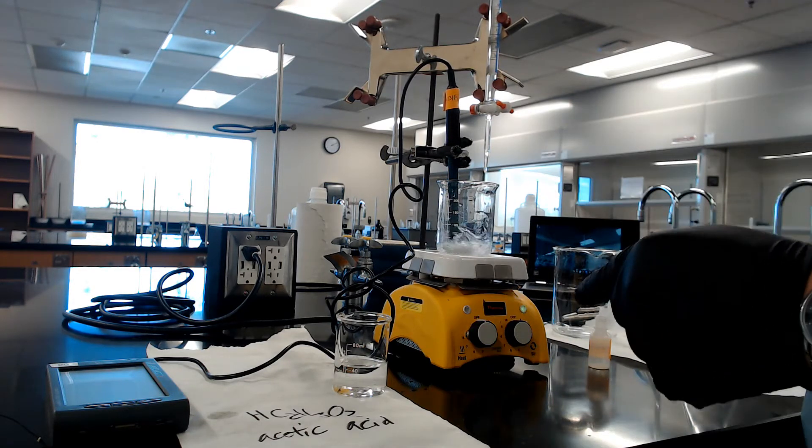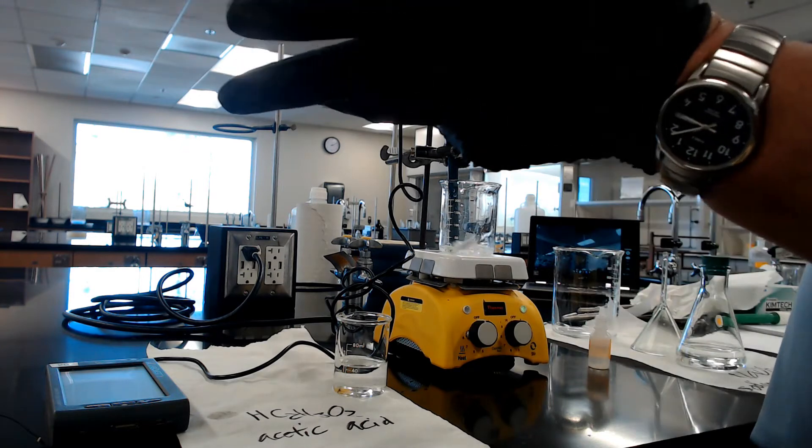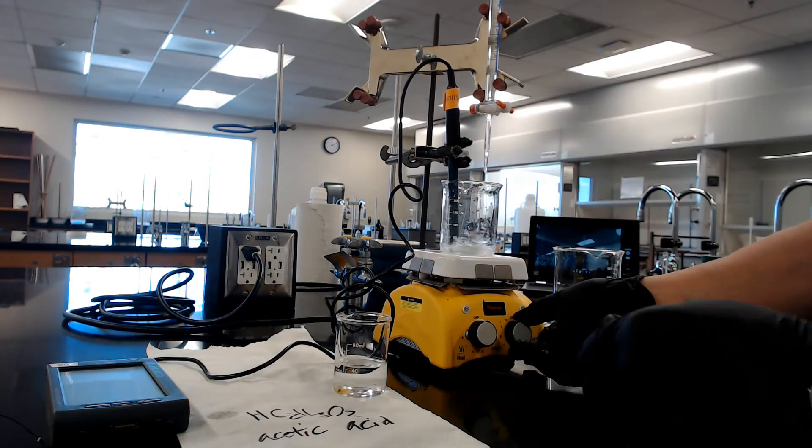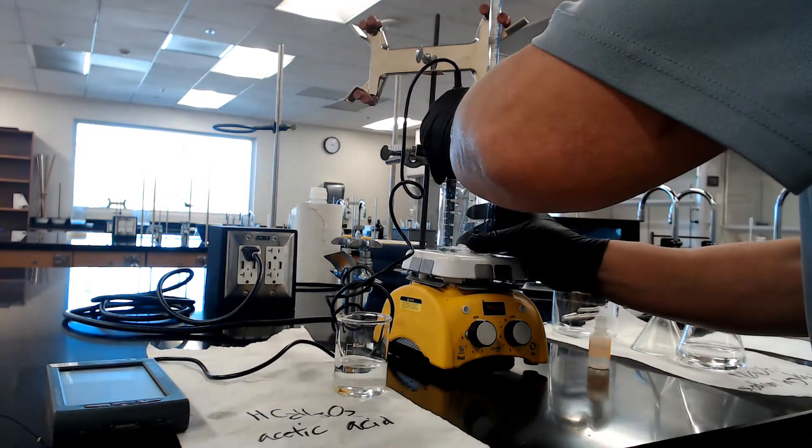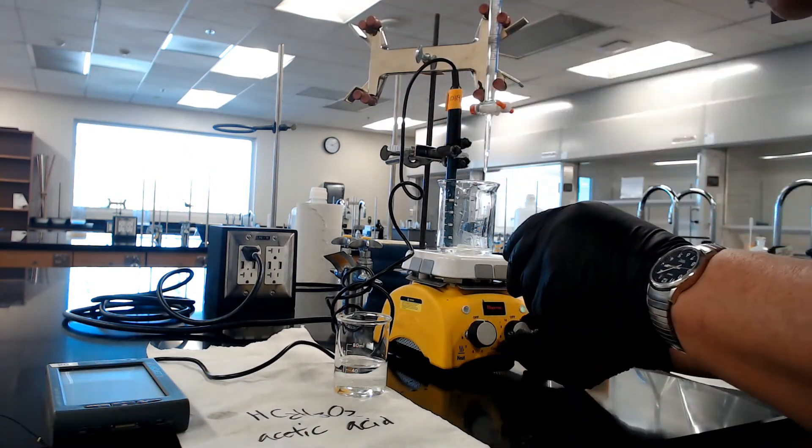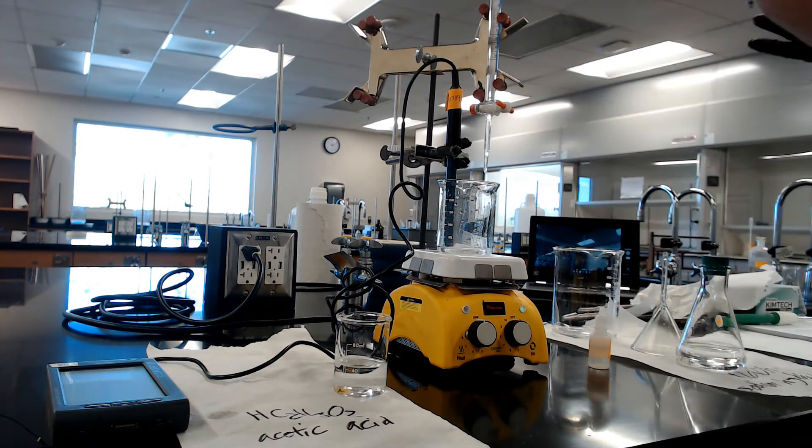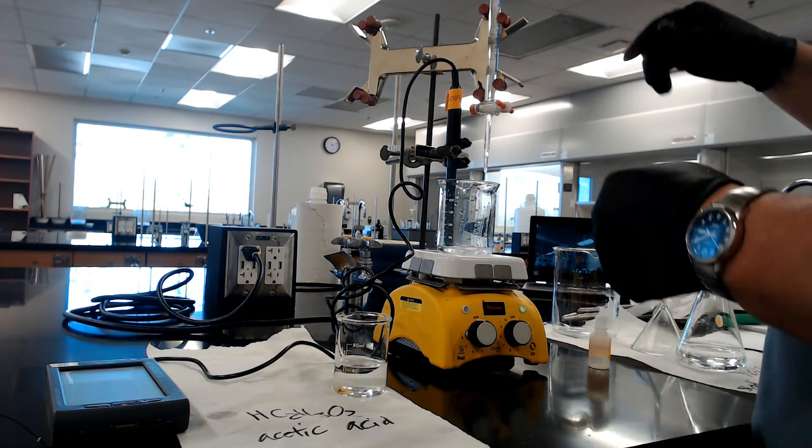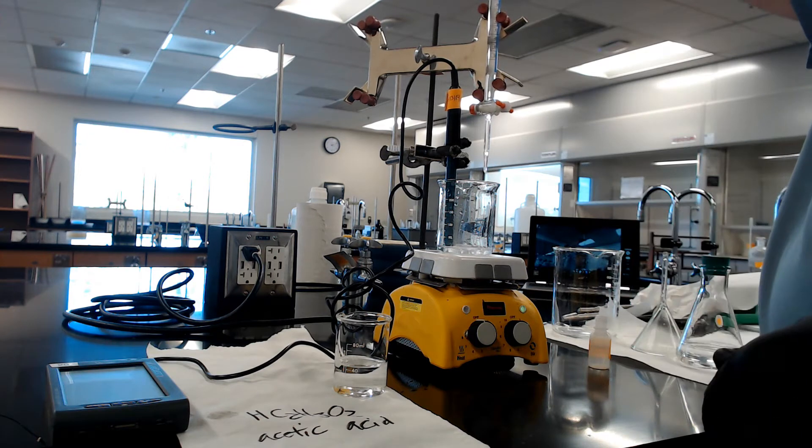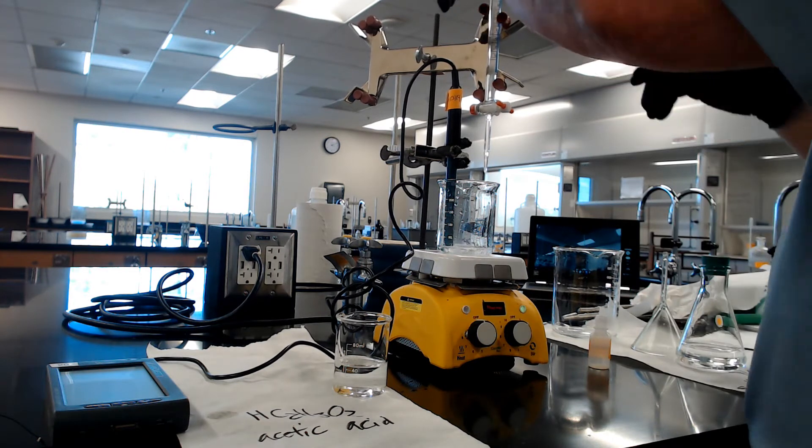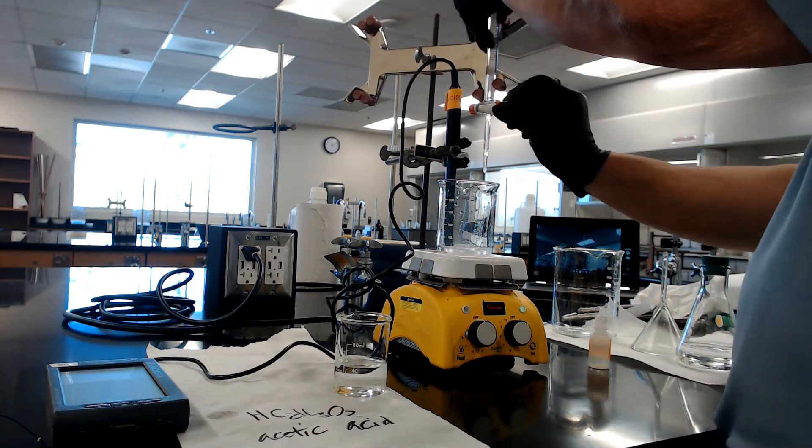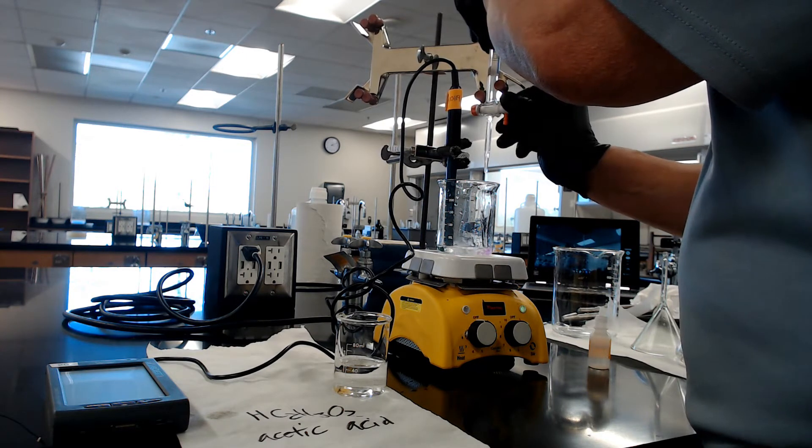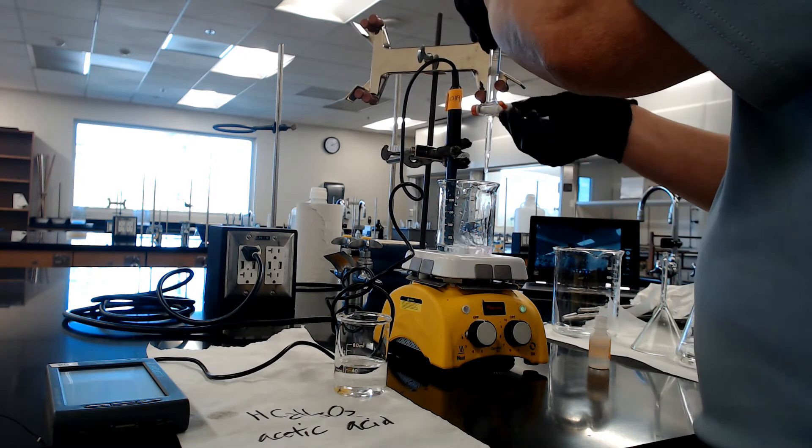Here's the initial reading. Last time I put a certain amount, I'm going to put half the amount. It's hitting the pH meter. It's running smooth now. We're going to start adding. Take the initial reading and target half as much.